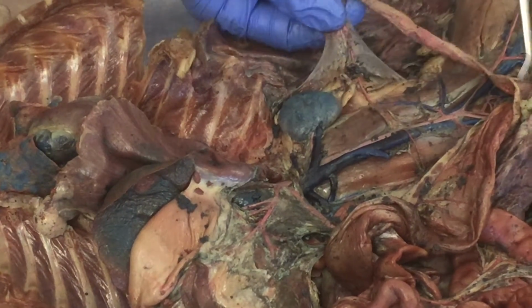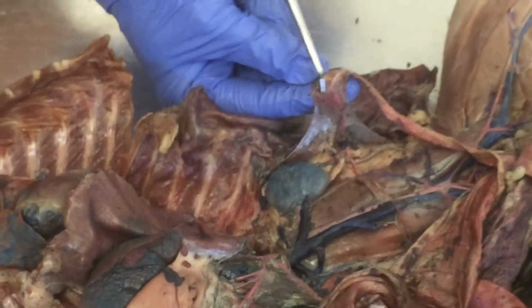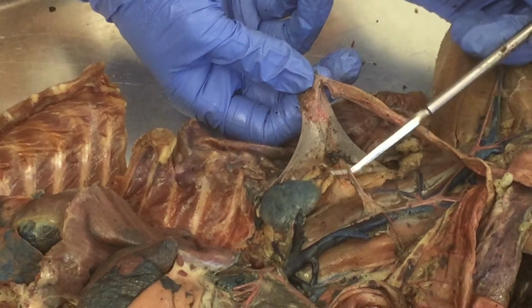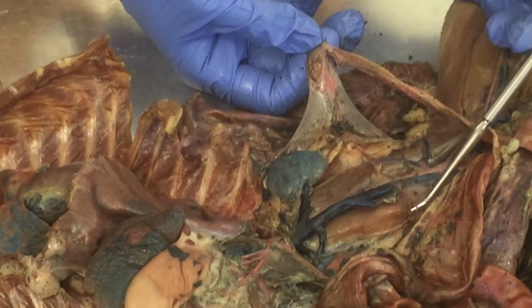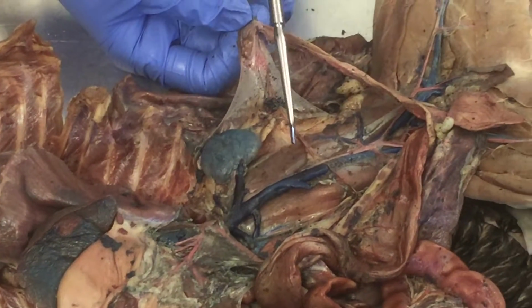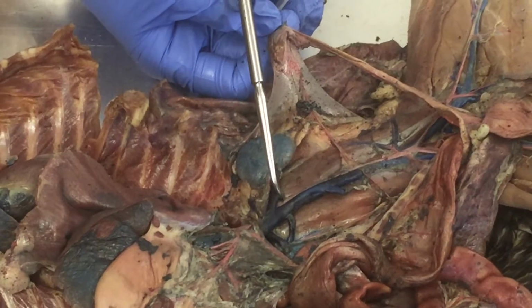So girls are going to have fallopian tubes and a kidney bean here, ovary. Okay. So that means that this red branching off of abdominal aorta is ovarian artery on the left, and here's the right one coming over to the right side, okay? Now, typically there is a vein that follows. The vein may come off of IVC. It may have been right here.